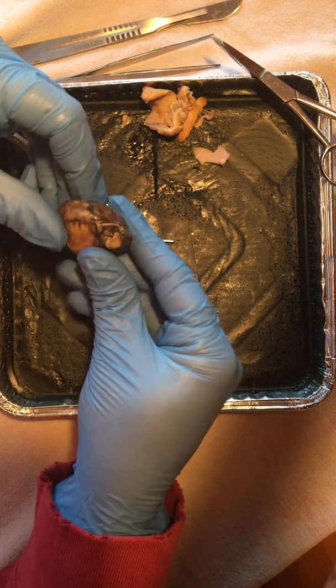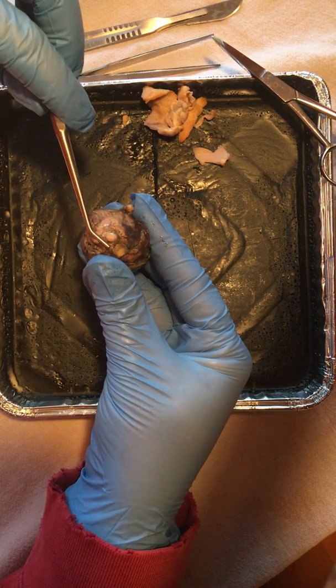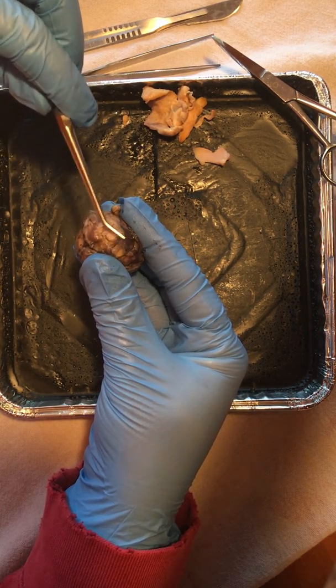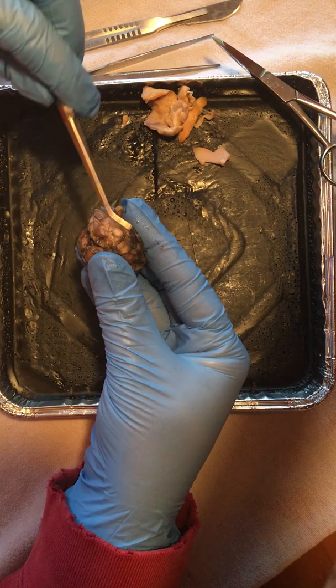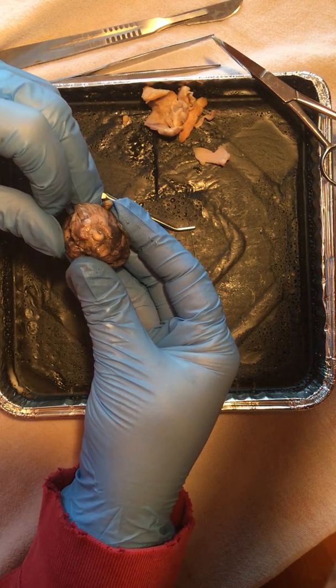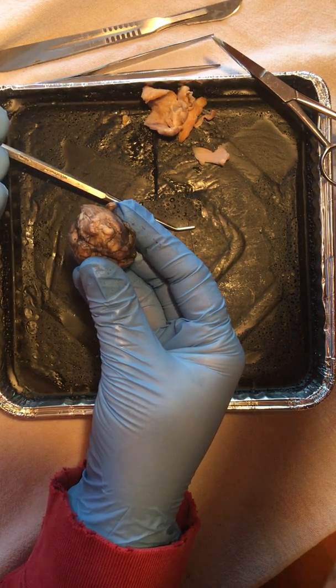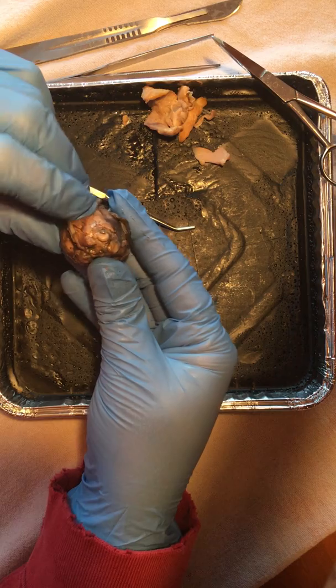And then we also have our optic nerve on the exterior side here, on this posterior portion. In this particular specimen, it's quite small, quite short, of course, where it's been severed. But that optic nerve is responsible for transmitting and receiving information between the eye and the brain. That nerve is also the cranial nerve 2.